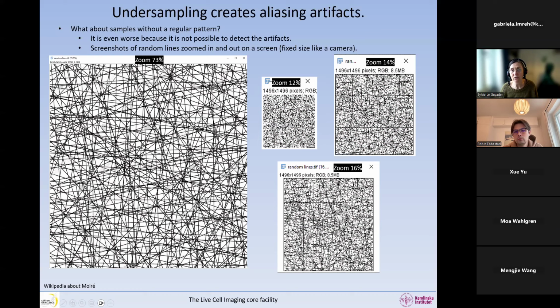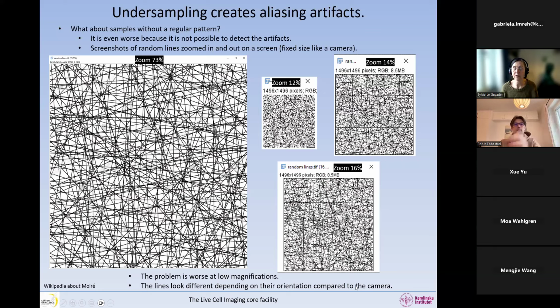So when I zoom in and out, some of the lines are correctly displayed, and then the rest is all scrambled. So it depends. This is what I'm saying, that it depends on the orientation. So the relative orientation of the screen versus these lines, they can be sometimes well digitalized and sometimes not. And the problem is worse with low magnifications. So again, matching the pixel size with, in this case, the screen size or the camera size when we image with a camera, the problem is worse with low magnifications. So the lines look different depending on their orientations compared to the screen or the camera.